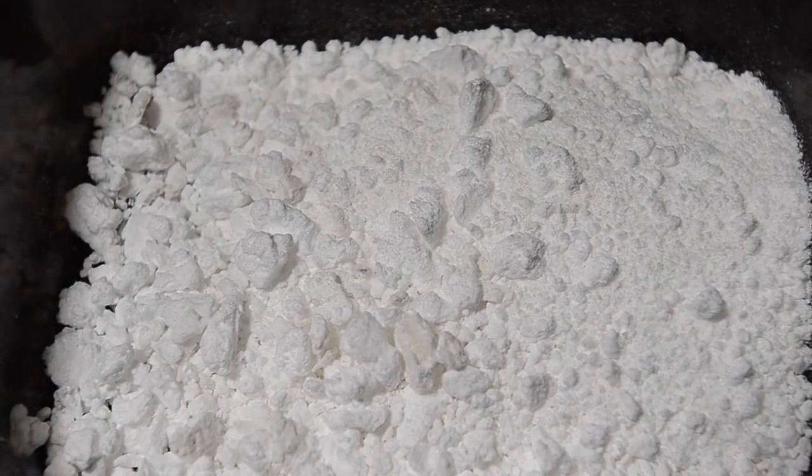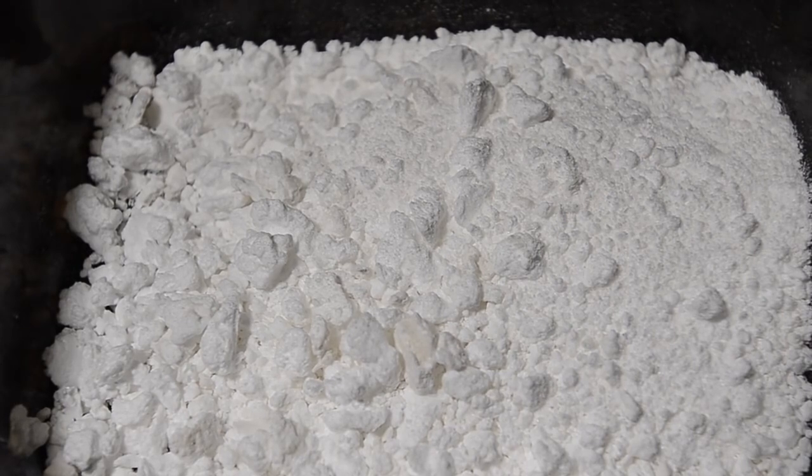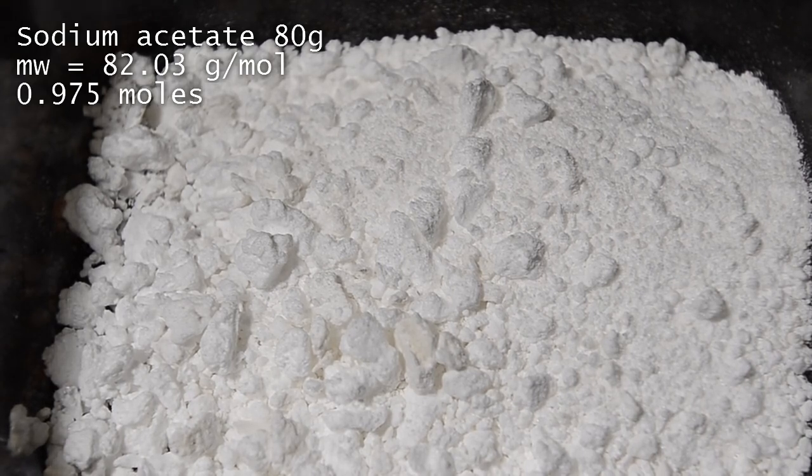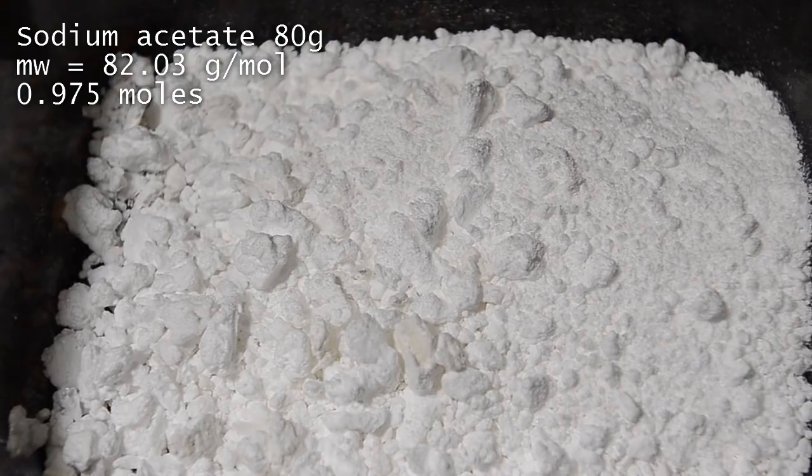We'll be preparing acetic anhydride the classic way using acetyl chloride and sodium acetate. The single most important thing in this reaction is that your sodium acetate must be anhydrous and completely dry.